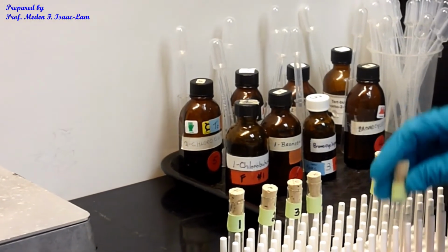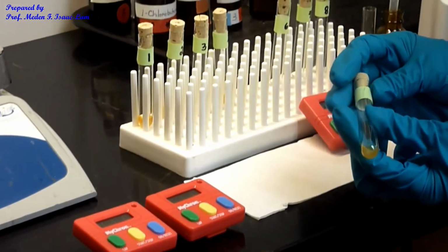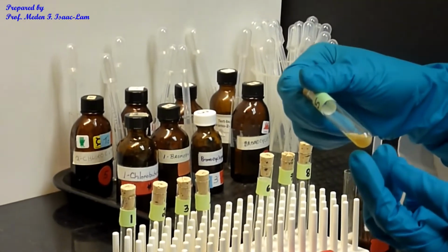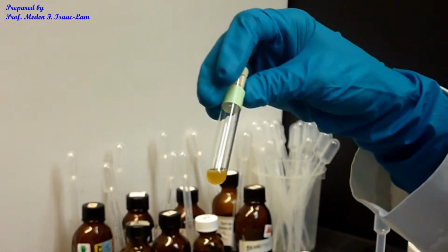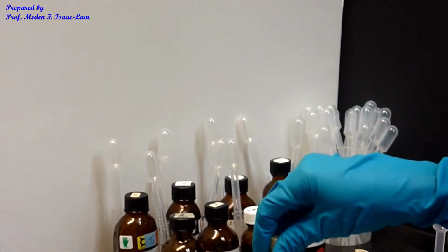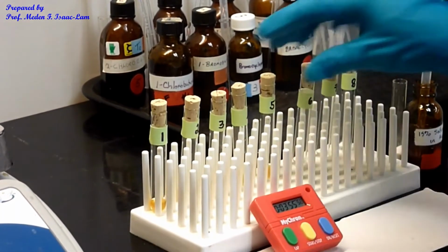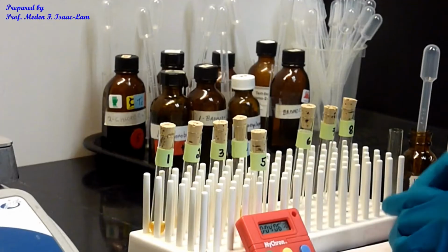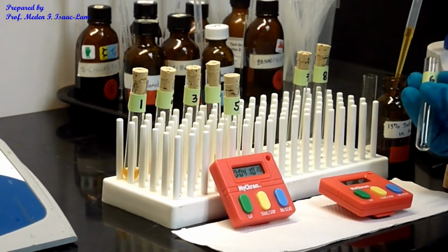Okay. So number 5, I see more at the bottom actually here. So it's about 3 minutes 45 seconds. Okay. So that's number 5 here. So I'm gonna start number 6. So the same idea.